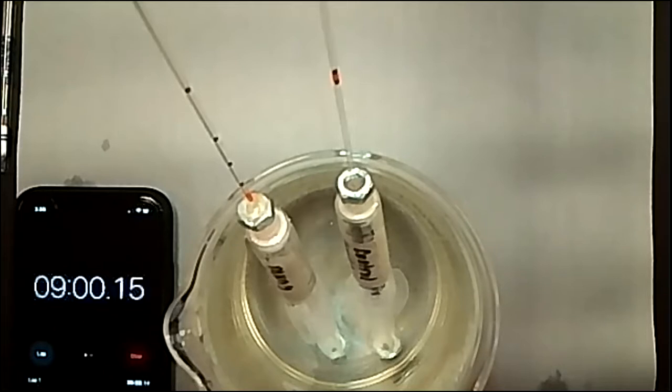And so for our 10-minute mark, we might be basically just at the base of the capillary tube, making that mark for the distance it has moved. So our measurements might be a little off because maybe originally between the 6 and the 10-minute mark, it was supposed to move a little bit and not that huge jump it just made from here all the way down. But we can account for that in our explanation when we write our conclusions. So that's okay.